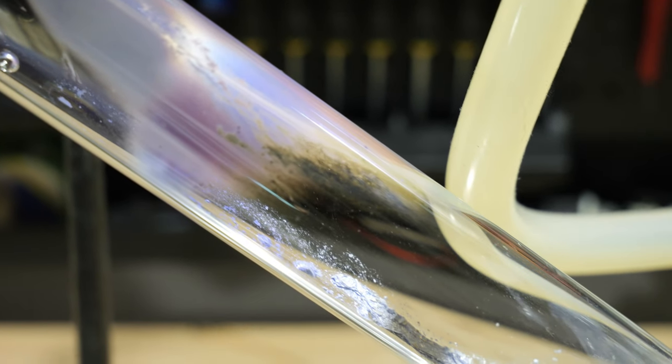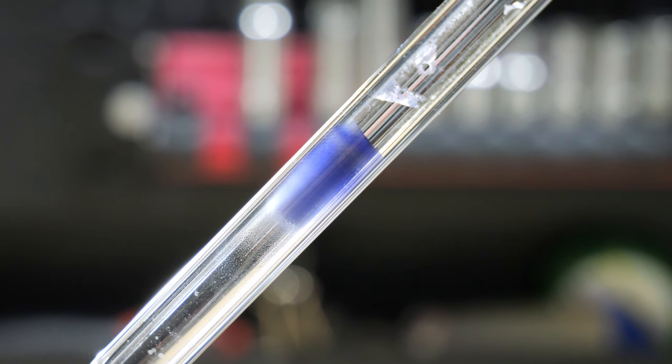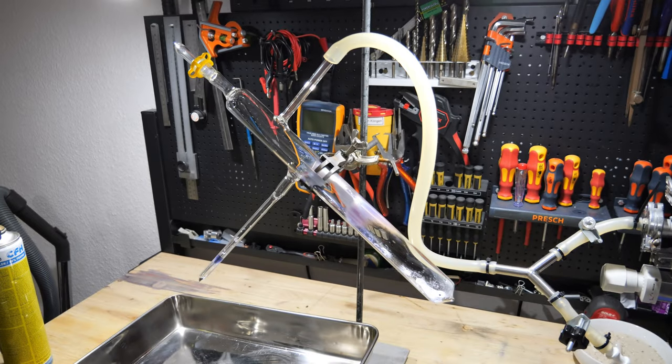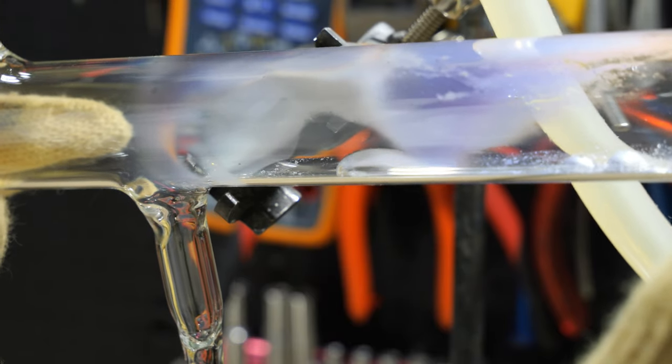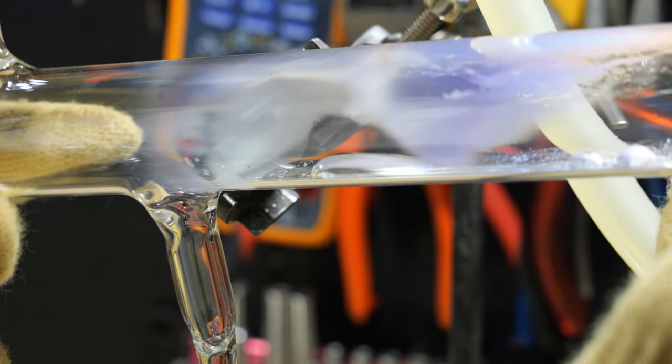By the way, I just wanted to show you the beautiful colors due to some potassium evaporating and condensing on the walls again. It is a sign that the temperature was too high, but at least it's a very pretty mistake. The remaining potassium was put into the leftover tube and also melted off.